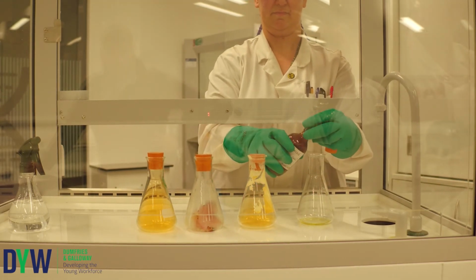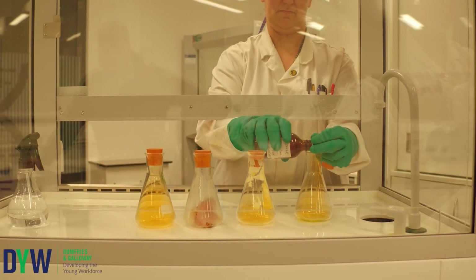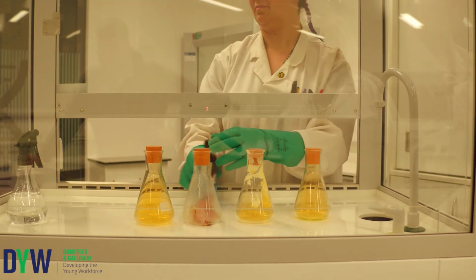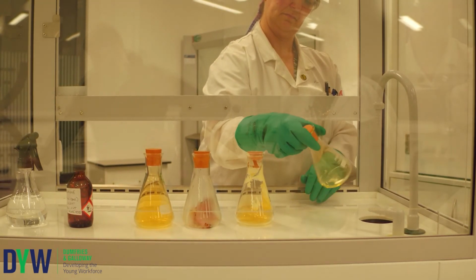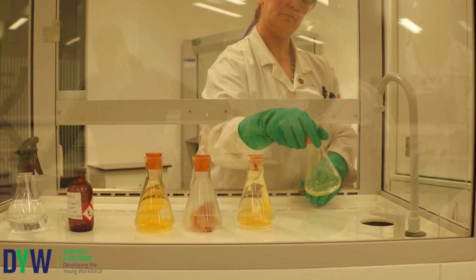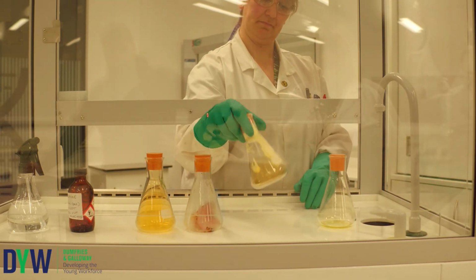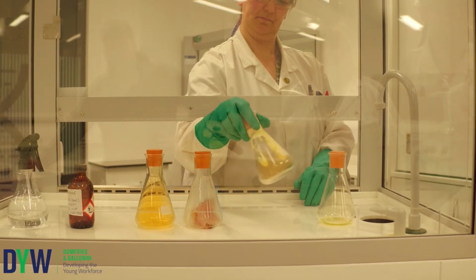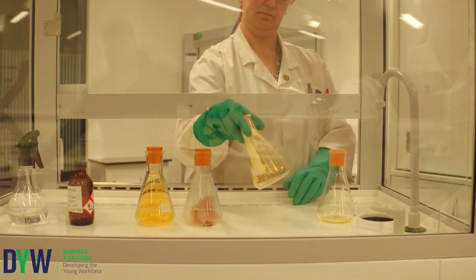And the last flask with our olive oil. We're now going to swirl the last two flasks, just so that we can get the bromine coming in contact with the olive oil, where you can see it's now decolorised, and also to come in contact with the margarine. It is decolorising, but it's happening quite a lot more slowly than I would have expected.